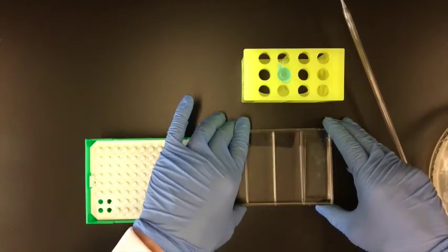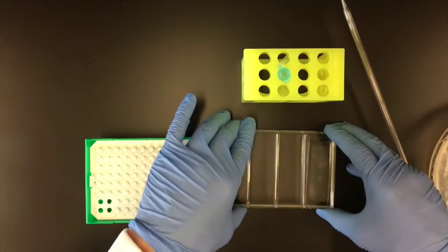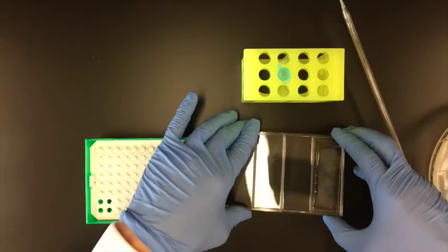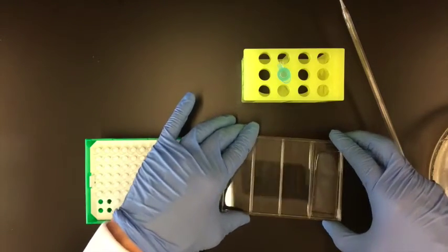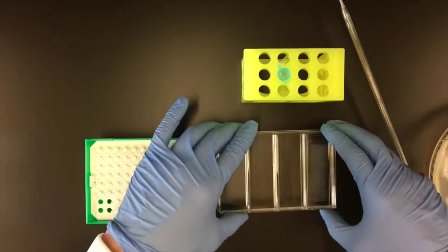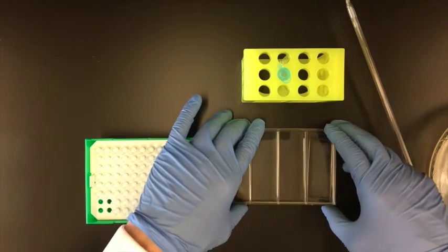So what I can do is rock the device gently, back and forth. I like kind of this motion where I'm going in the X, Y, and Z plane at the same time to get an even distribution of beads across the surface.